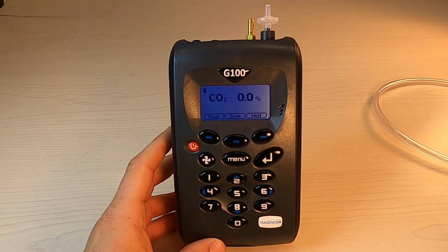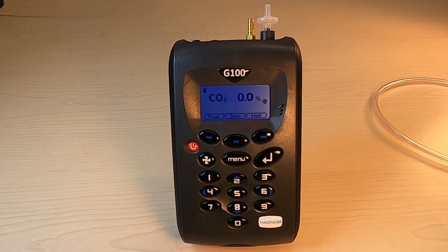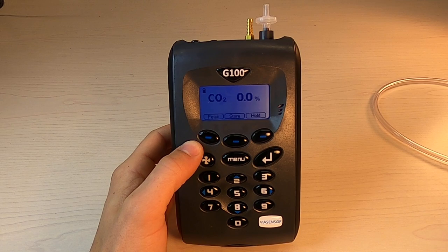At this point, regardless of whether you're taking another reading or shutting the machine down, you'll want to run another clean air purge, allowing the gases to re-stabilize and using a clean sample filter, of course. After that, you're ready to shut the device down. And that sums it up — thank you guys for watching.